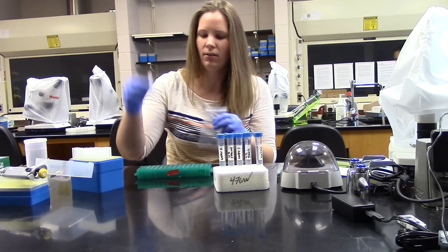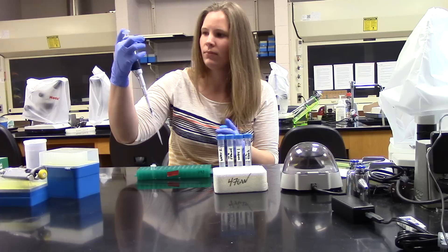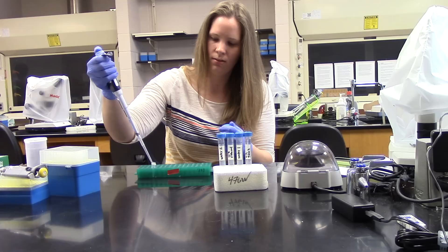We will add 450 microliters of saline. This is the solution that we are extracting our microbes into. Now close this and set this aside.